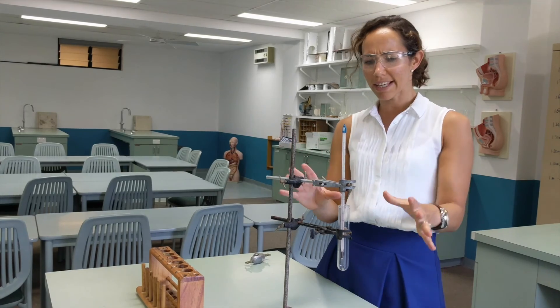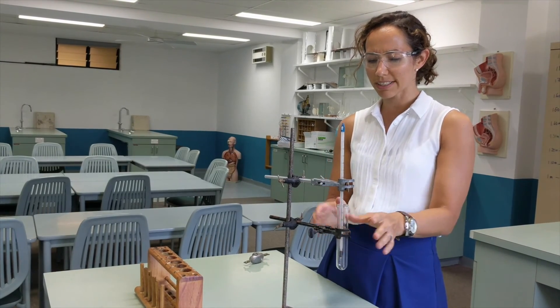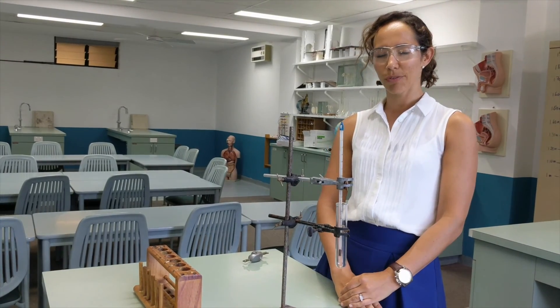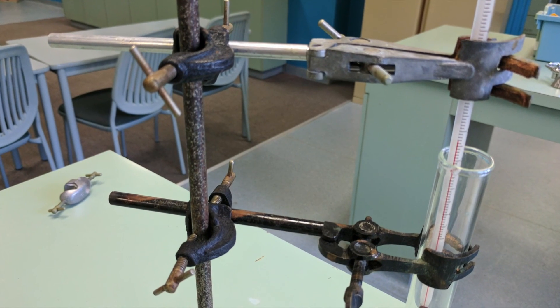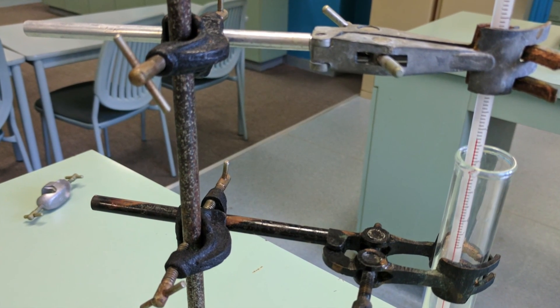Don't be afraid to manipulate and play around with them until it all fits, but once you're done you are completely hands free.